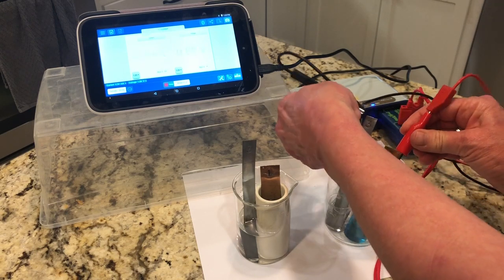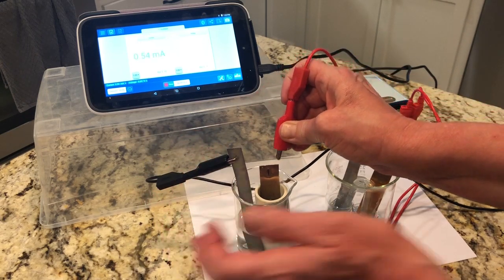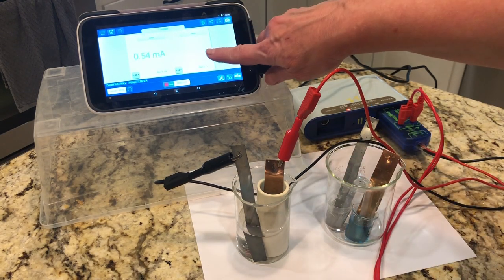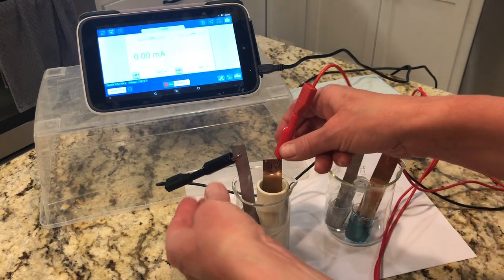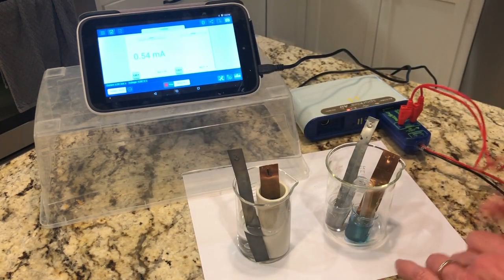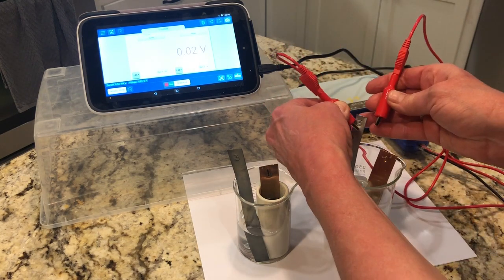Let me see what the voltage is in the other cell. Black lead goes to anode, red lead to cathode. Oh, same voltage. Well, that makes sense because we have the same two half cells making the cell, and the concentrations are the same. So now we're going to look at current. I'm going to use a different function on this Pasco setup. And for the cell on the right, let's see what the amperage is.